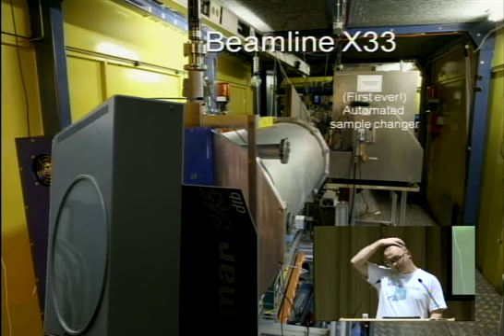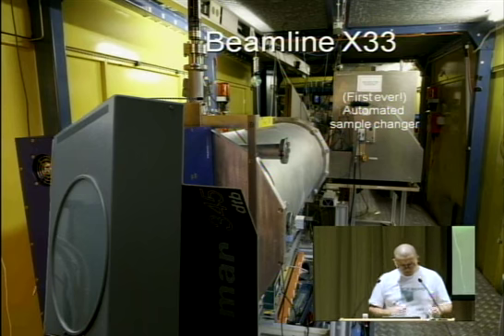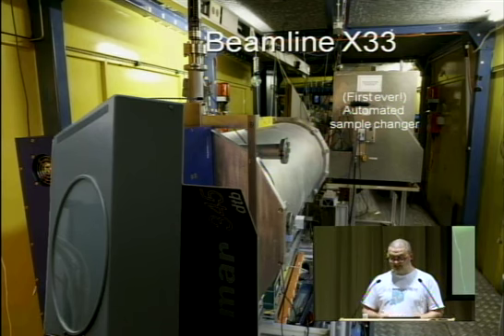But the big advantage of that beamline was that we constructed a sample changer, which is basically a pipetting robot that can pipette your sample. You can just add your samples and your buffers in Eppendorf tubes, and it will pipette your sample inside the sample cell where it is exposed to X-rays.